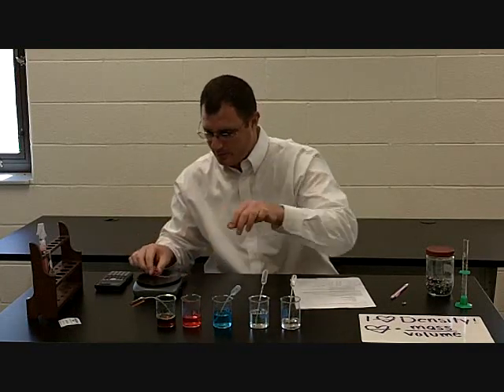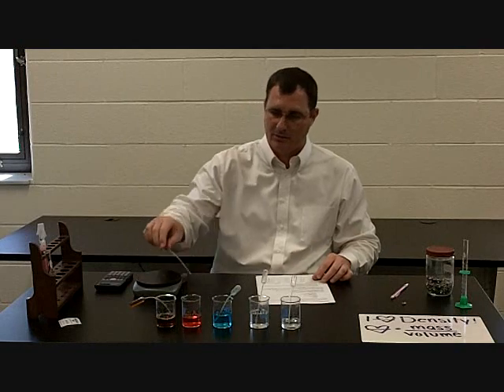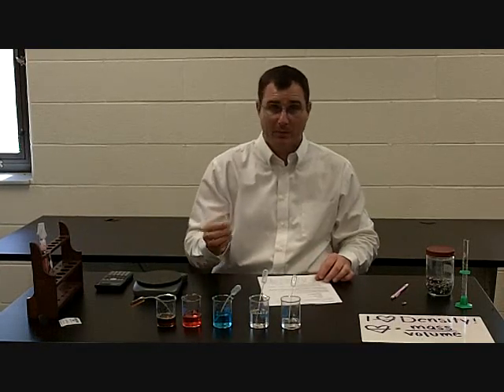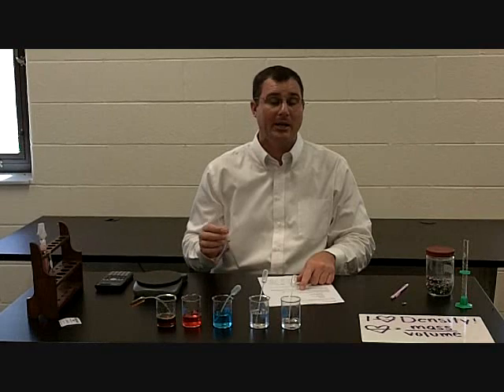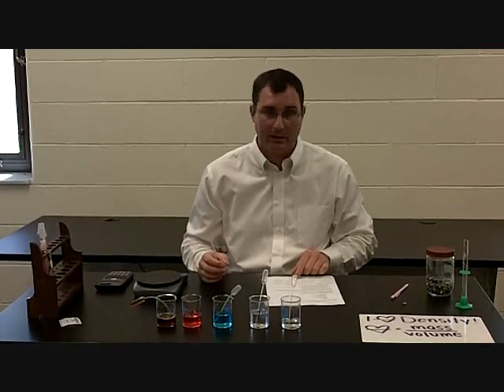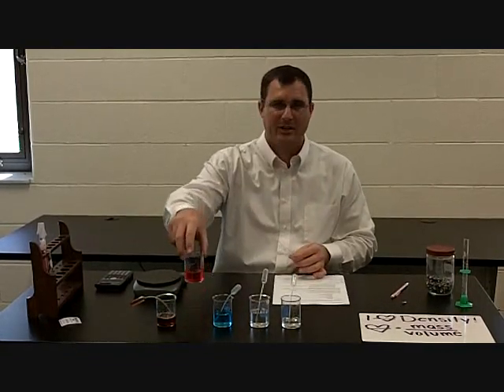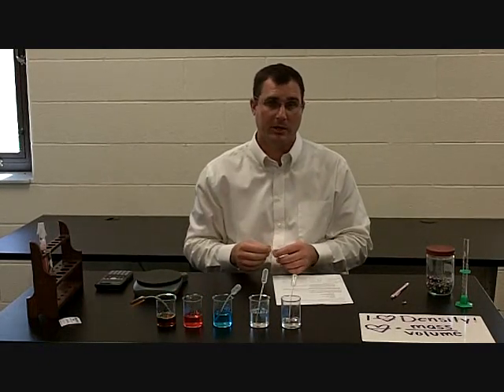So once I do that, I'm going to re-weigh, and I get 5.7 grams. If I subtract the weight of the pipette that we initially had, 5.7 minus 0.9 grams, that leaves me with 4.8 grams as the mass of my water. By the way, I put red food coloring in the water just so it stands out a little bit more, but that's all it is — water with red food coloring.